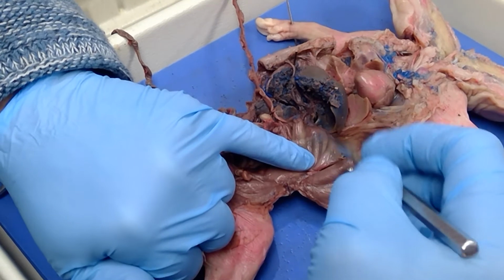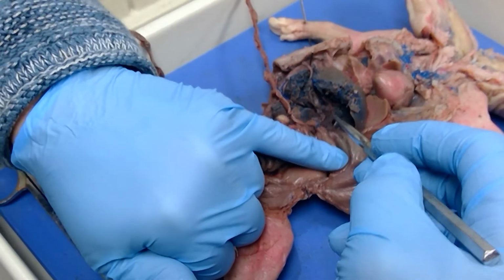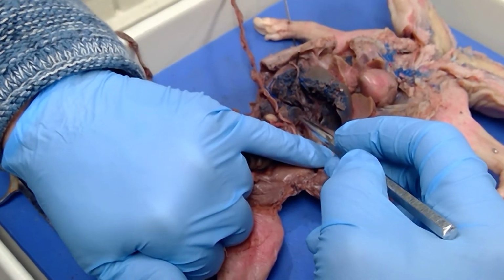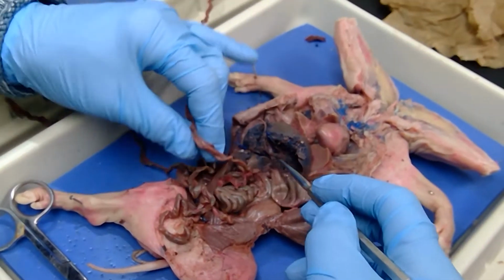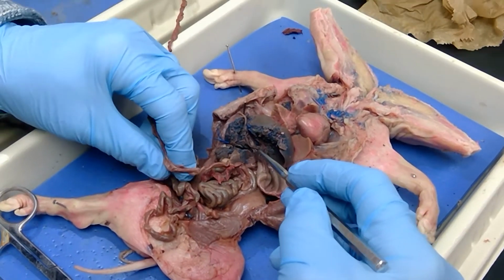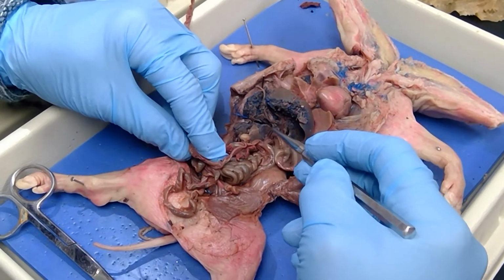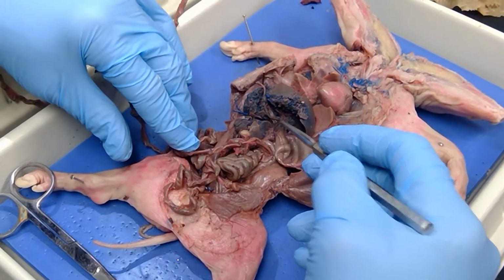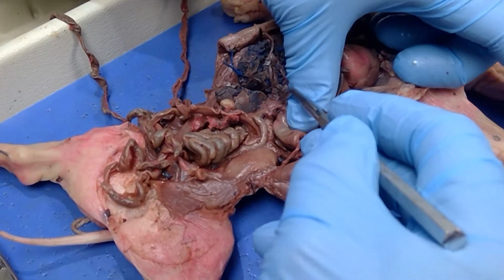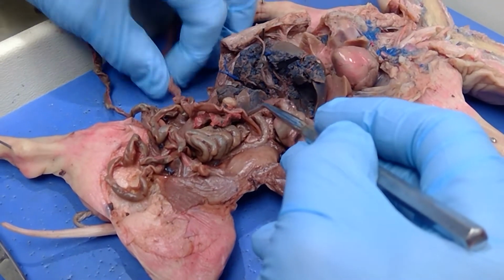Okay, the stomach is going to take the food, it's actually called chyme at that point, into the small intestines. So this right here is the first part of the small intestines. That's the duodenum. In a human, the duodenum is about 12 inches long. So I'm saying here in the pig, I'm going to estimate that it's about 1 inch long. So it starts right here at the pyloric sphincter, and it comes around like this right here, and starts coming out this way.